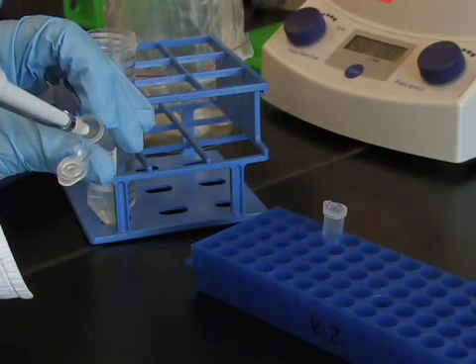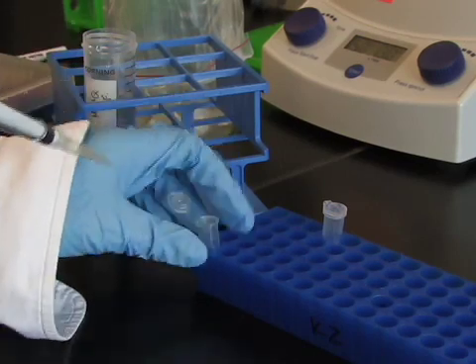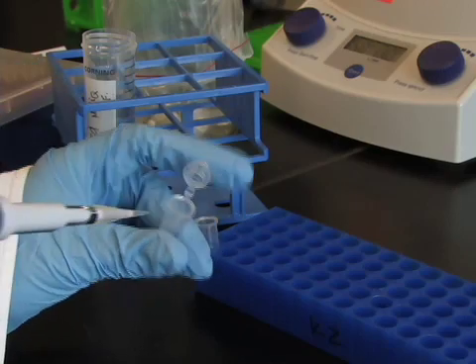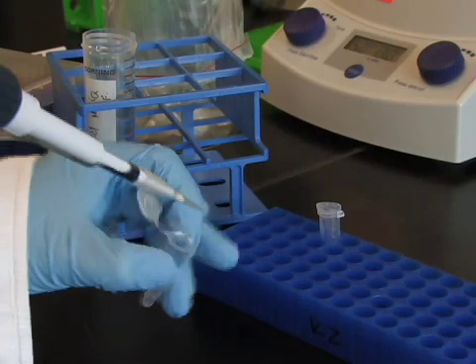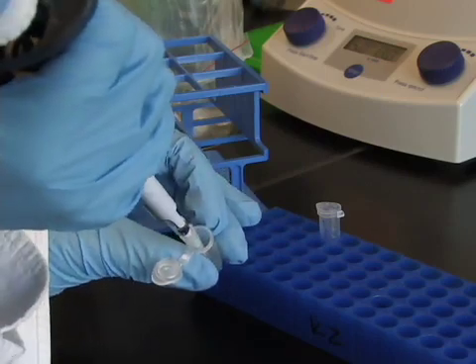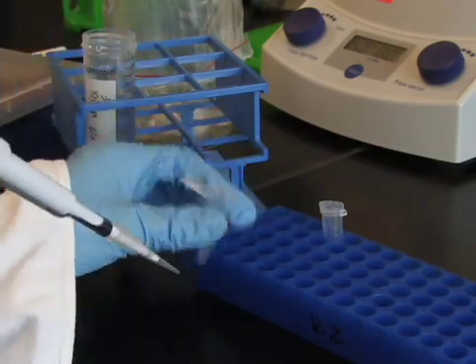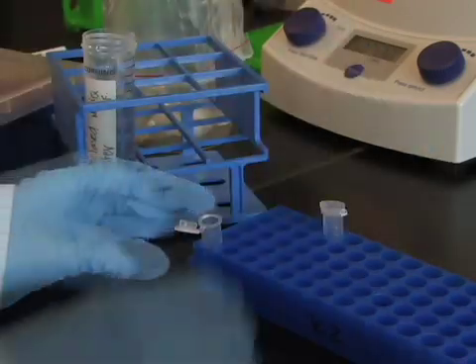Ideally you want to use less than 50 micrograms of DNA per set of bullets in a total volume of 50 microliters of water. Keep in mind that the exact amount of DNA to be used should be determined empirically for each construct based on obtaining the optimal expression level.